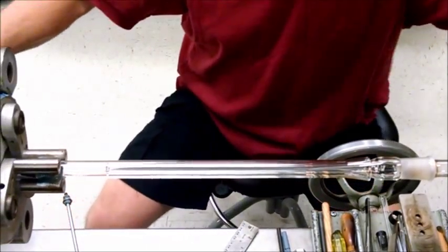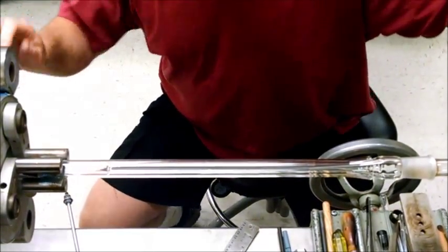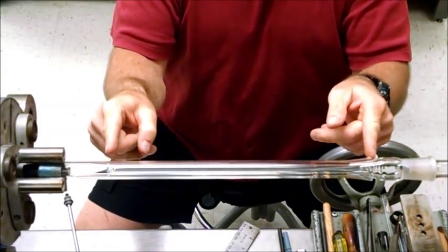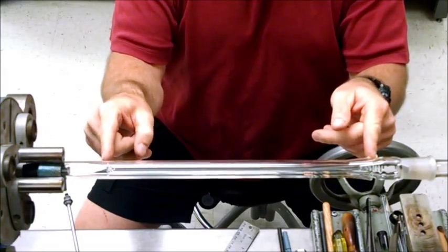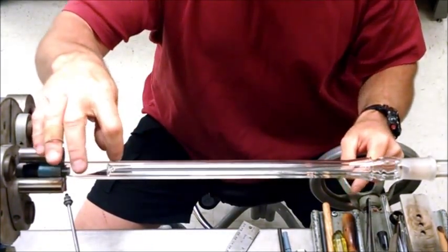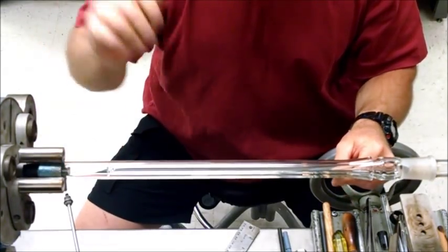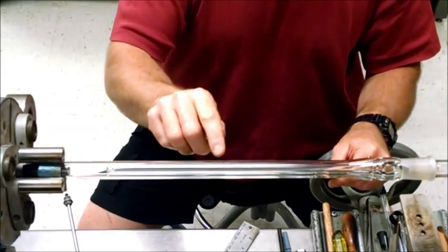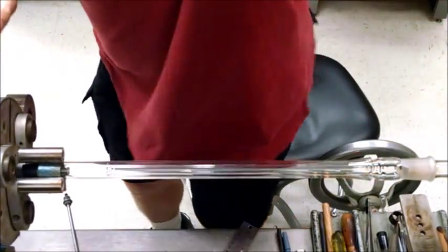The catch is this tube on the center piece is holding 300 millimeters from ring seal to ring seal. What I did was, on the long side, I flared up slightly and I put a little hole on this side, so when I come down and tack on to this, I'll still have a blow to the center tube. I'll show you.